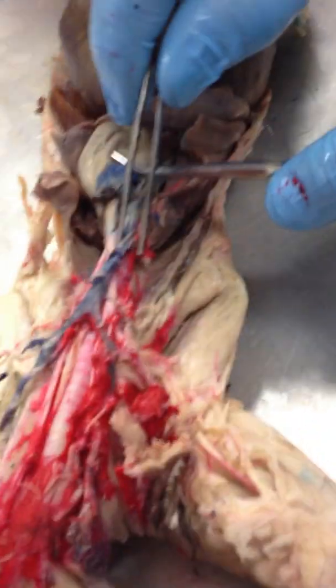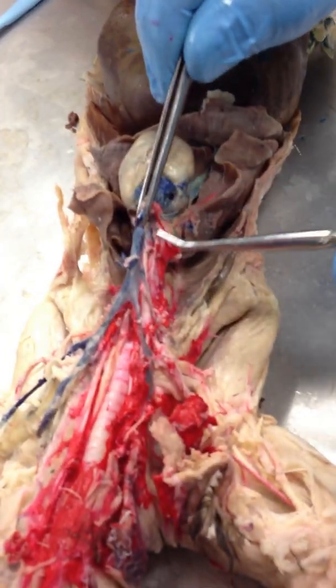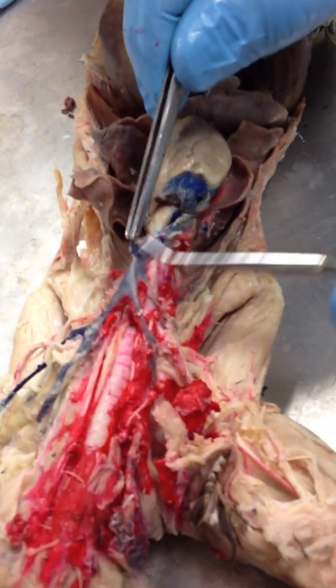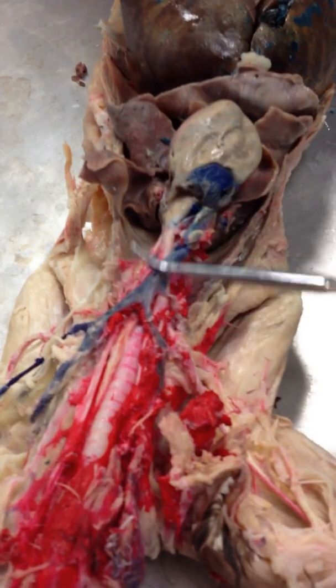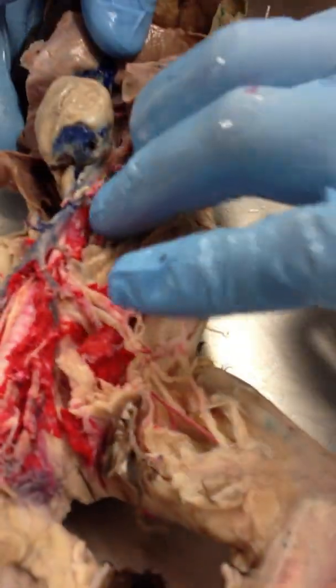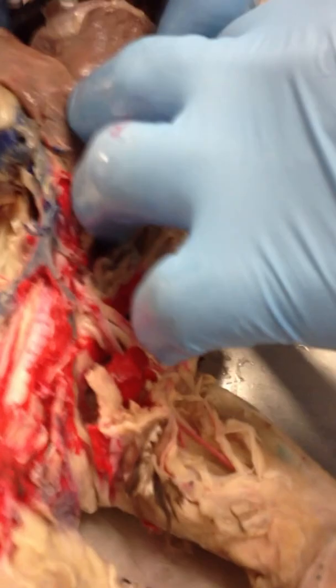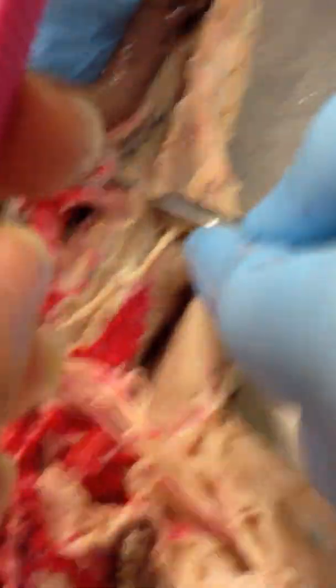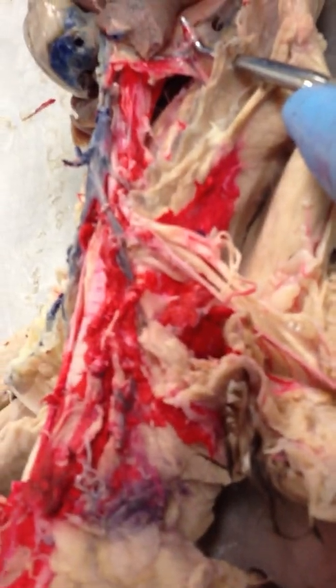Now if we go over to the veins, we've got our heart again right here. This is our pre-cava. This vein right here is our internal mammary vein that comes up perpendicular. Over here, we have our azygous vein coming down right there.